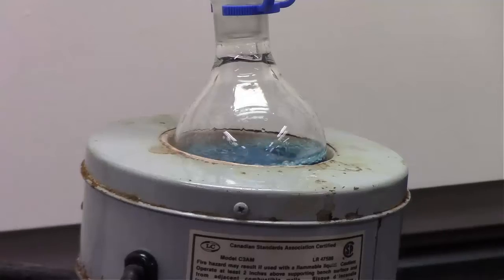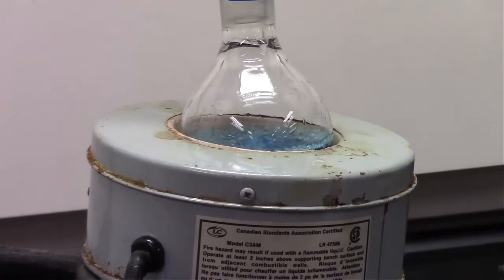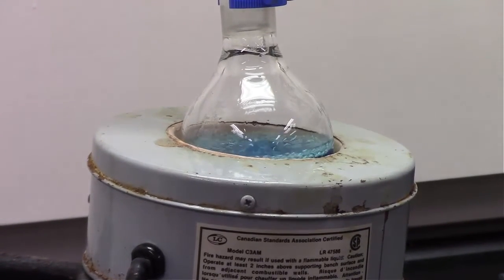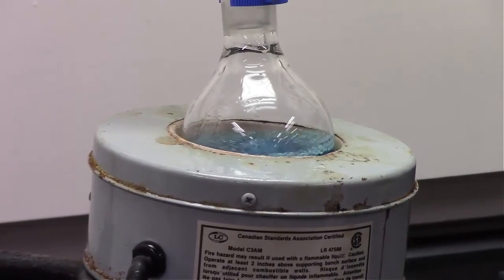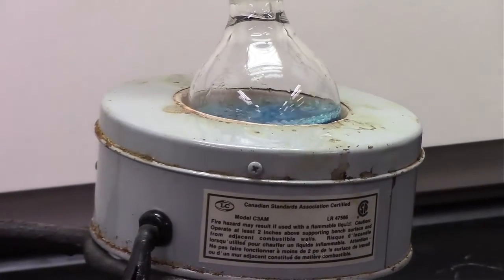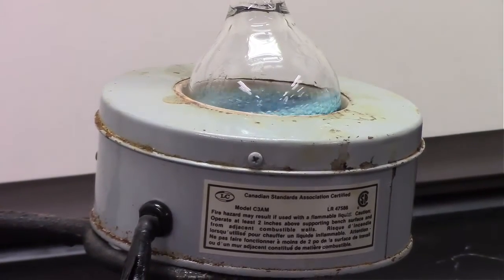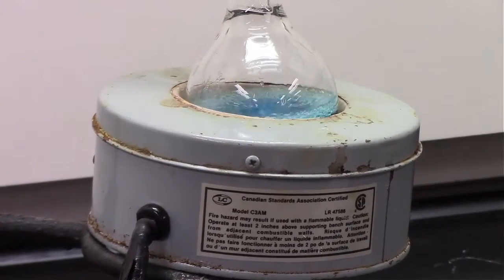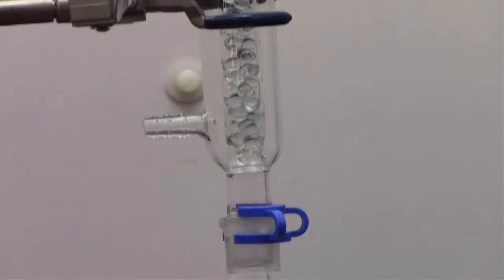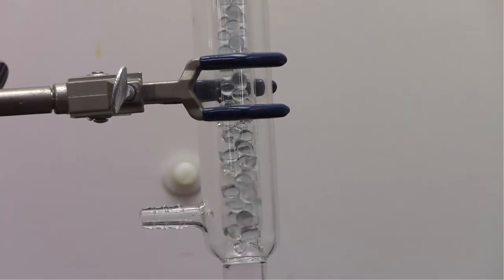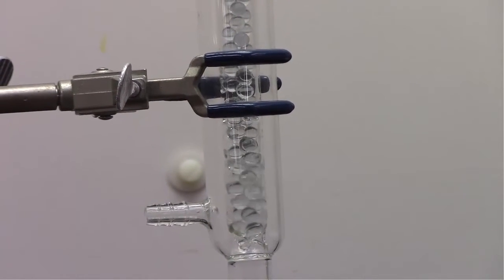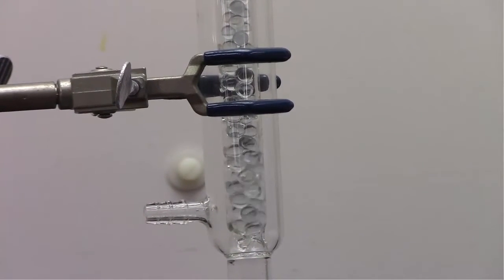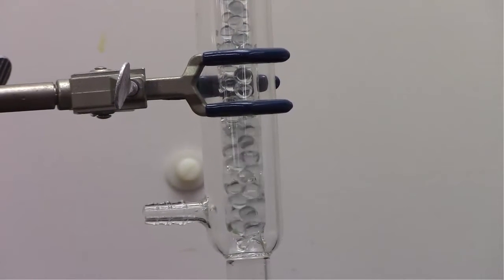So, at this point, now that we've heated it up, our evaporation condensation cycles are starting. We're essentially boiling our solution of liquids. And slowly, we are rising up our condenser, which has beads in it, allowing more surface area for more evaporation condensation cycles to happen.